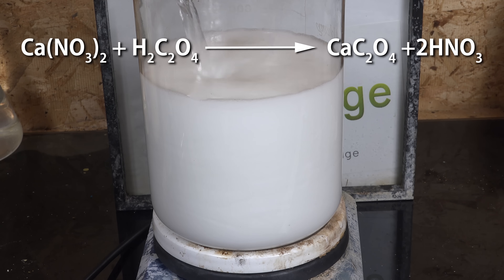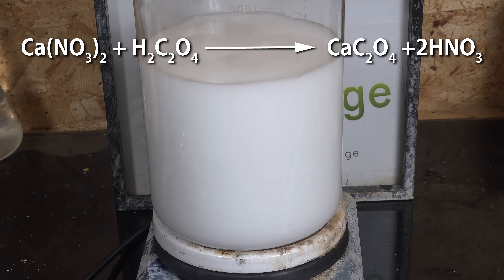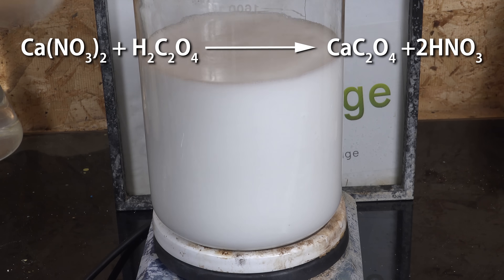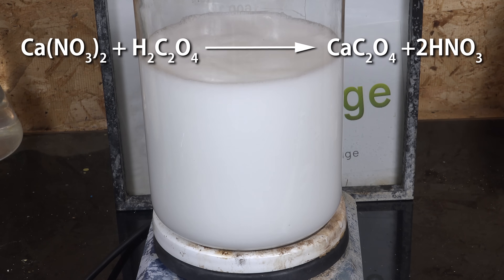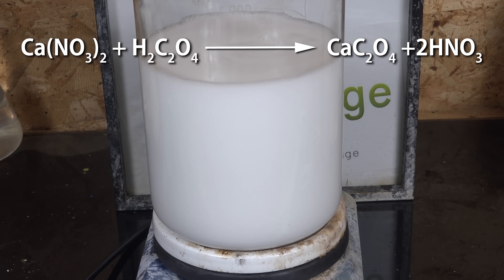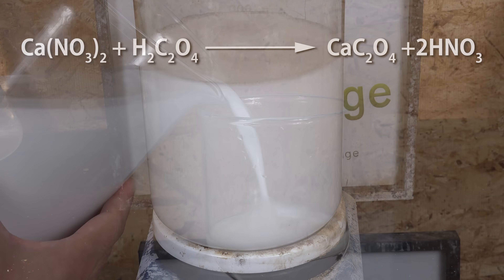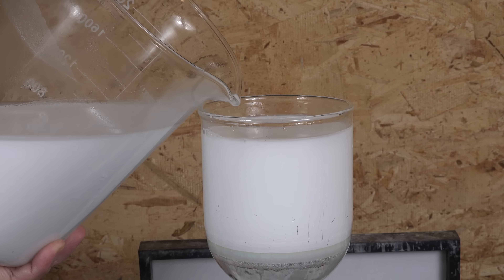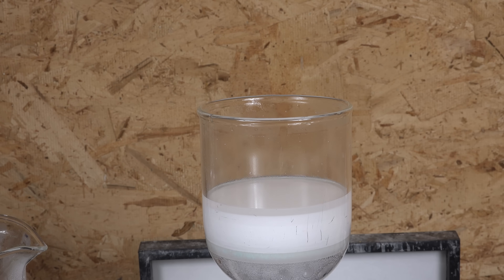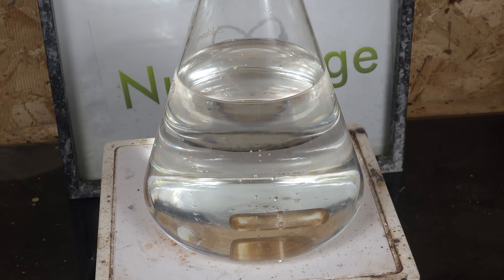Normally you can't make a stronger acid like nitric acid from a weaker acid like oxalic acid. But the solubility of calcium oxalate is so low that it drives the reaction forward and allows for the formation of nitric acid. Anyway, filter off the calcium oxalate and collect the filtrate. And there it is — very crude nitric acid.